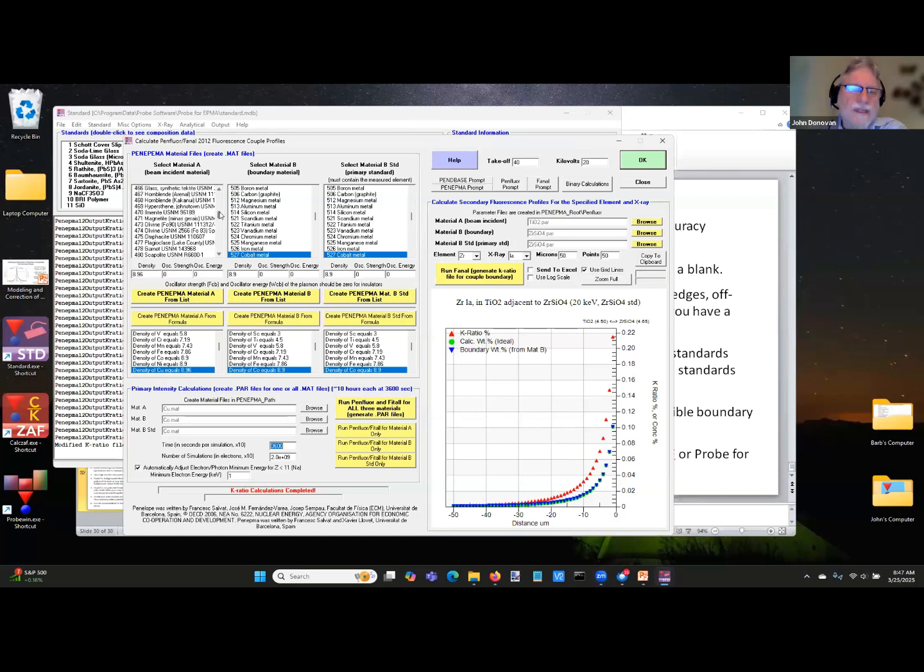In the list of standards that comes with the software, there's all the Smithsonian compositions, so you can do your olivine or your obsidian. I think there was a good obsidian example here. I'm trying to remember what it was. Yeah, obsidian, you can put in an obsidian material.